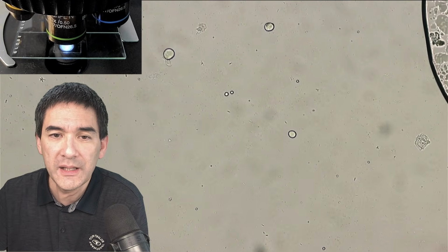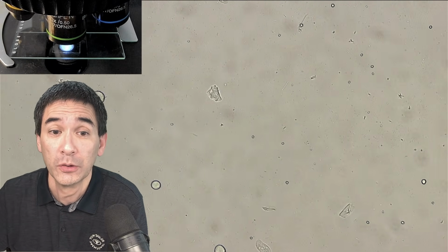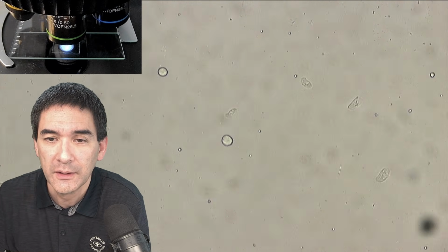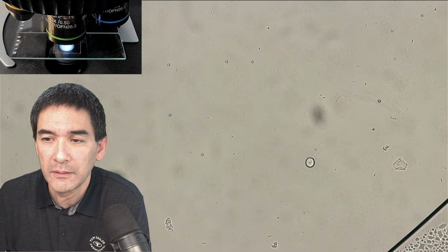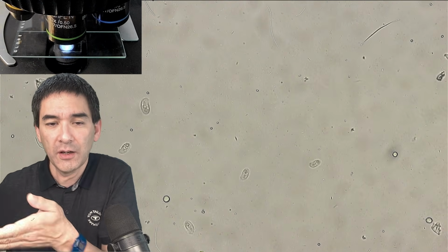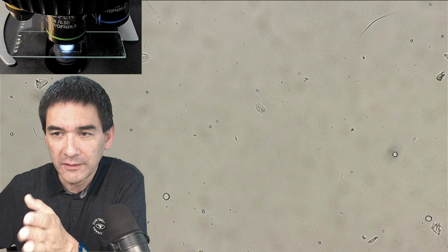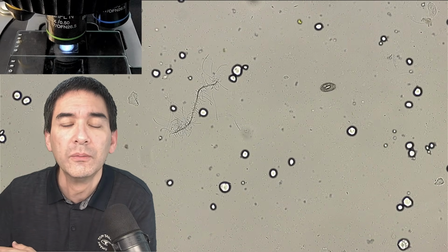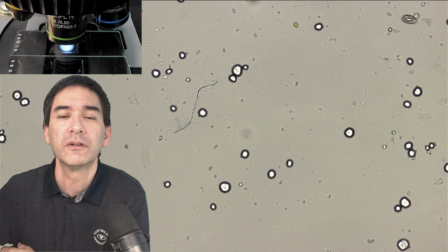If the water sample contains more algae, for example, then they would also look more green because they take on the color of the food that they eat. So this is lower concentration, obviously. Sometimes you can actually see how they're turning, and then you see that they're actually quite flat, right? But let's go back to the other one. So this one was the one from. Wow, look at this! This is kind of interesting stuff here.